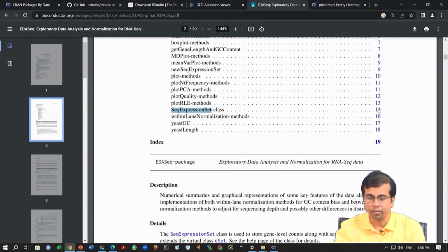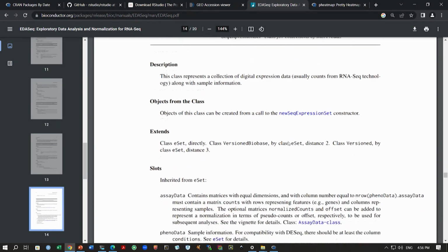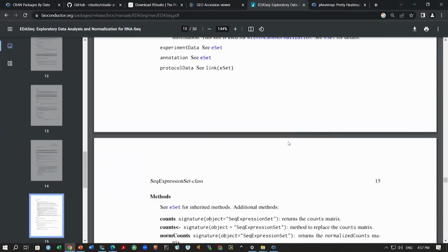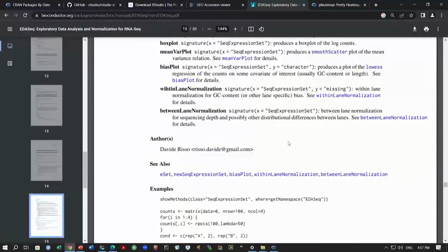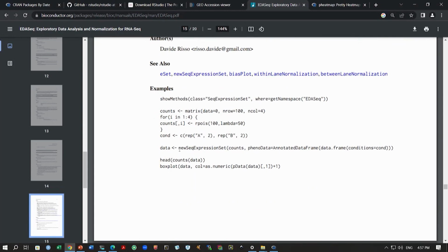Okay, so again we can go to this withinLaneNormalization method or maybe seqExpressionSet part, right. This is a class of data, right, that we need to create from our count data. Okay, and again this is mentioned how you can create this, right, what kind of attributes or data methods that you need to include in there, right. So, and there are some examples how you can create this, right. So, the function is newSeqExpressionSet, right. So, we have to give the counts, then we have to give the phenoData variable, and then we have to generate this and assign this into this data variable.